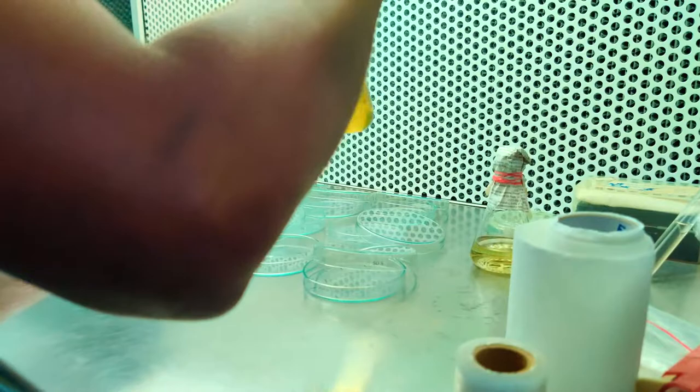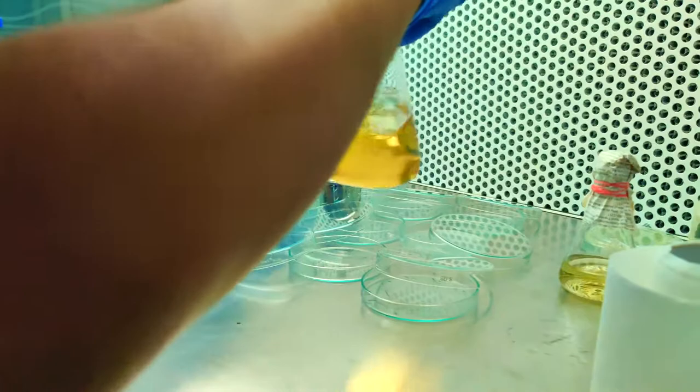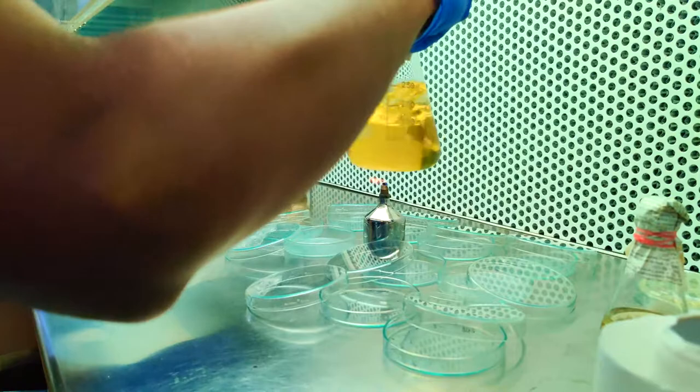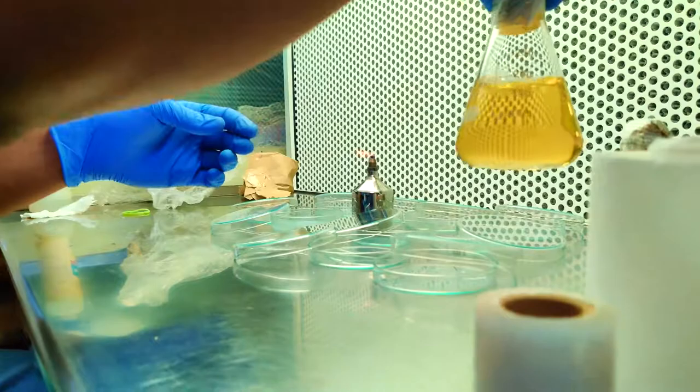After properly mixing, then only we have to take off the cotton plug. Make sure that your medium is not touching the cotton plug. Now it's okay, properly dissolved and mixed equally.